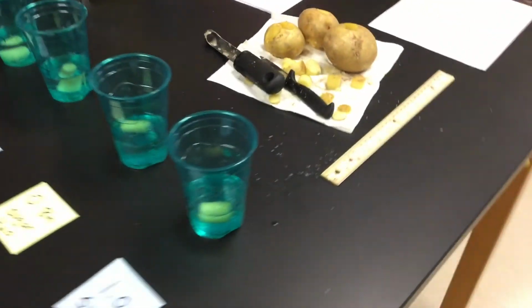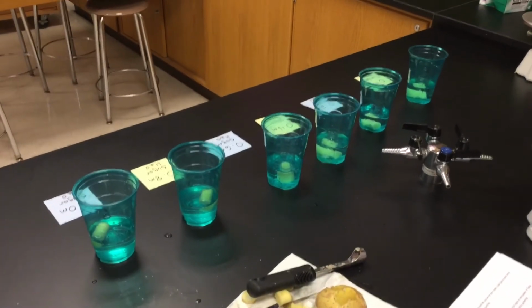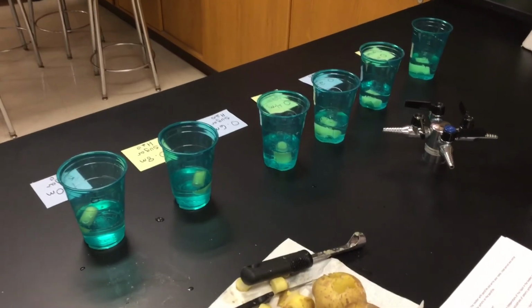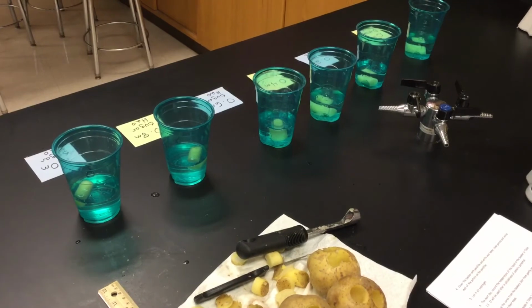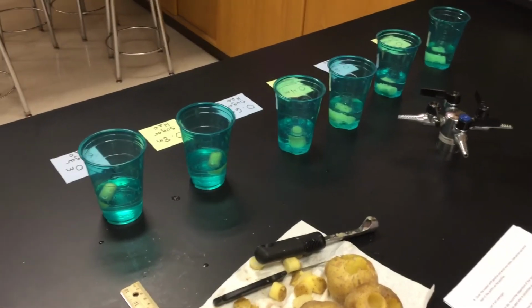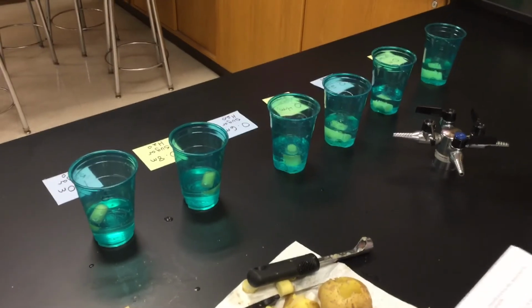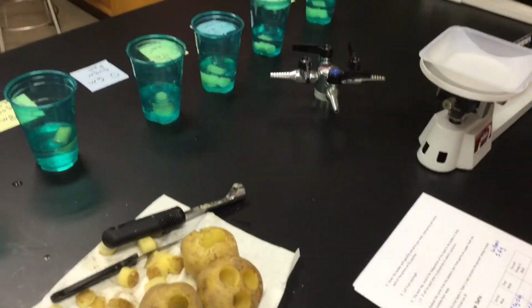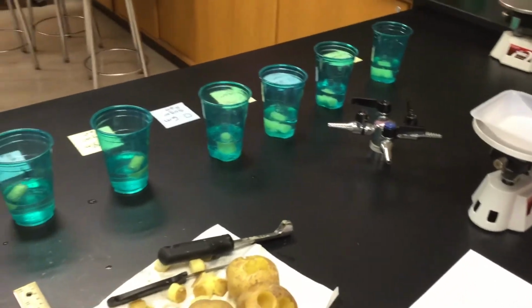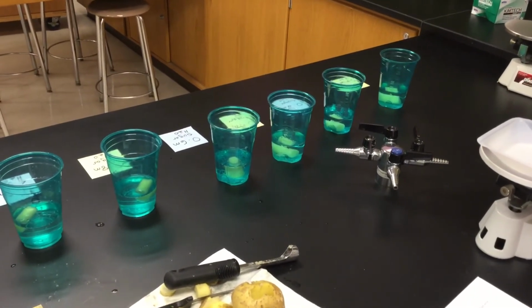Somewhere along the middle here, you're going to find a spot where that potato reaches equilibrium, and that's going to give you the molarity concentration of that particular potato. How much solute does it have? We can find it out by looking at sugar solutions. What that means is that it will not gain or lose mass. It may not be exactly 0.4 or 0.6. You guys will be graphing it, and wherever that graph hits the 0 mark, it may be like 0.32 molarity, but you'll be able to determine it based on the graph that you have.